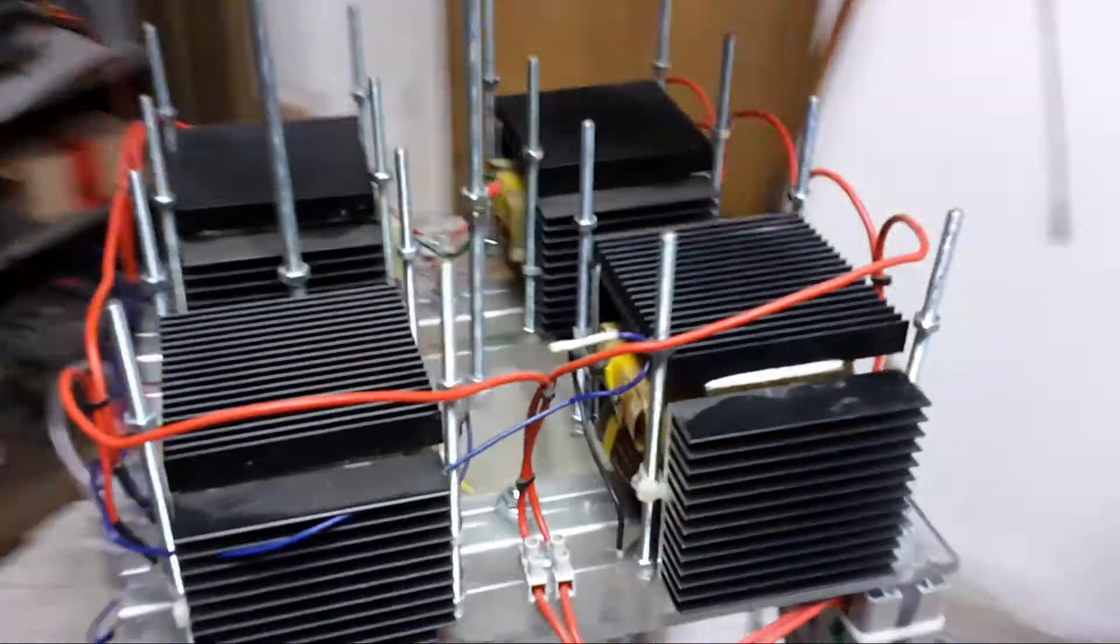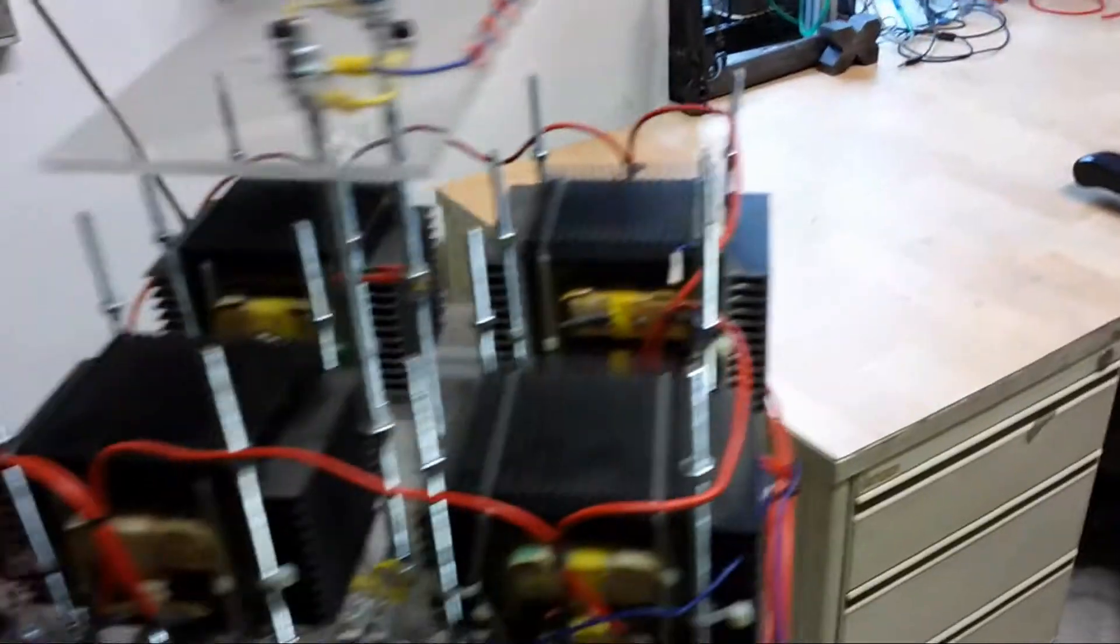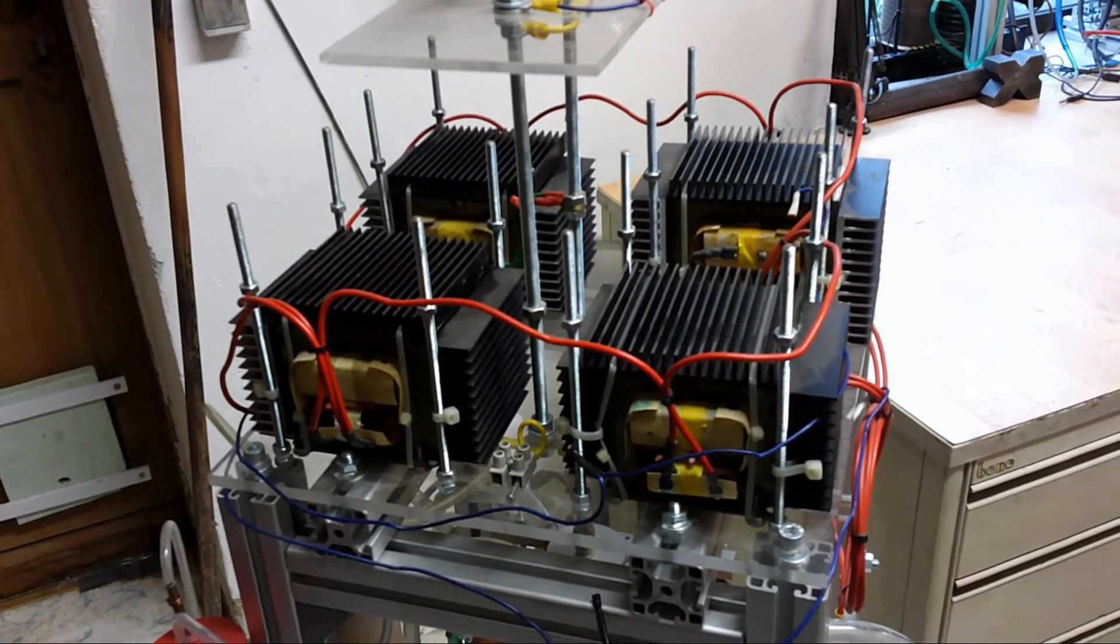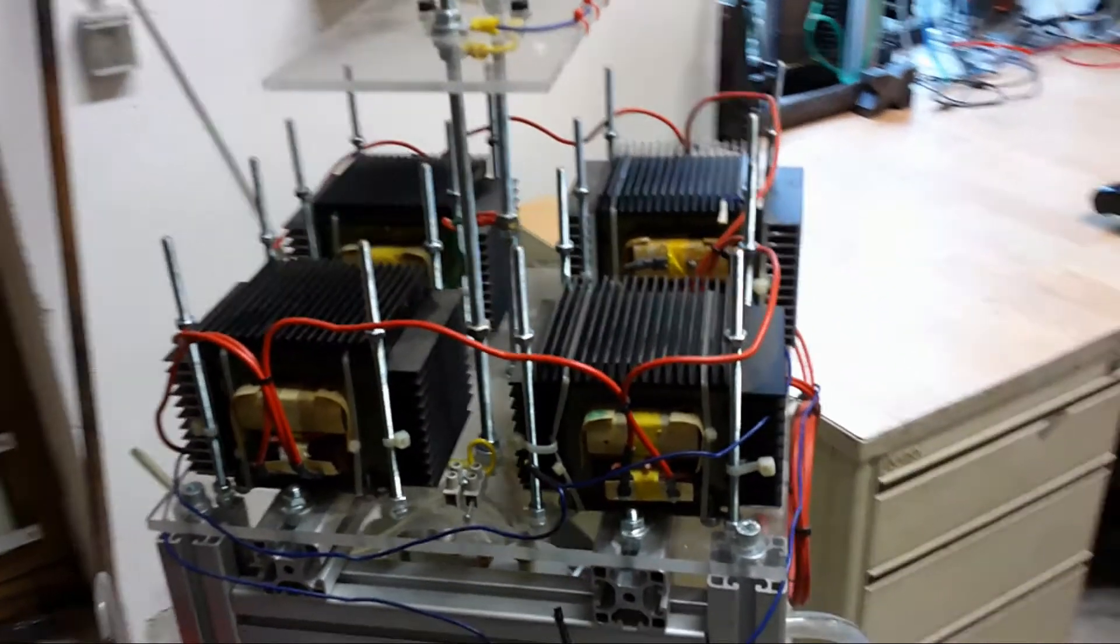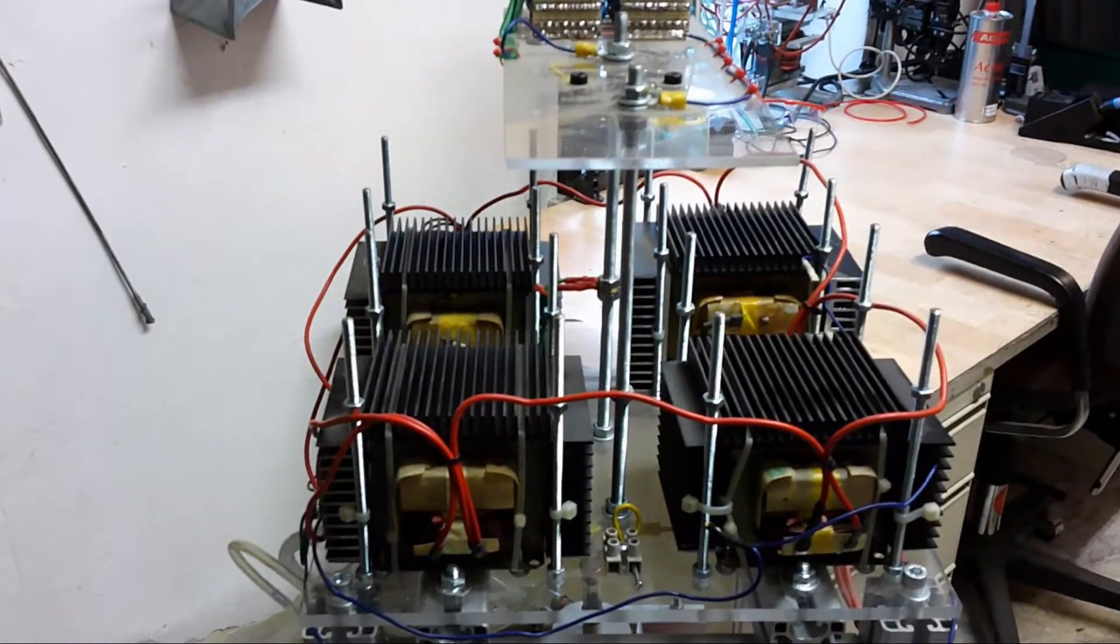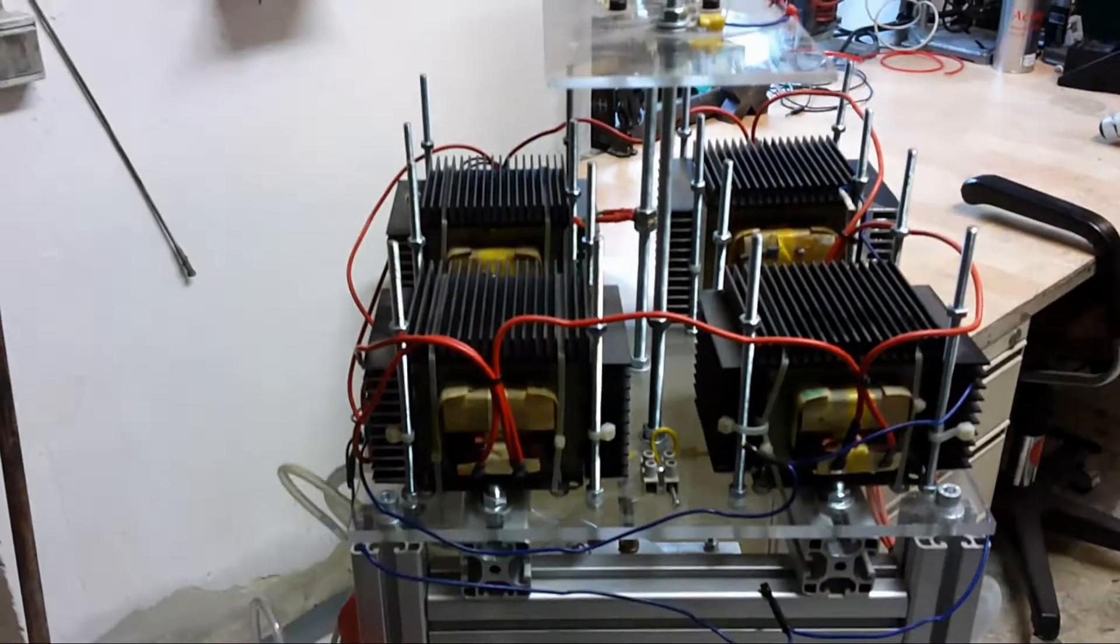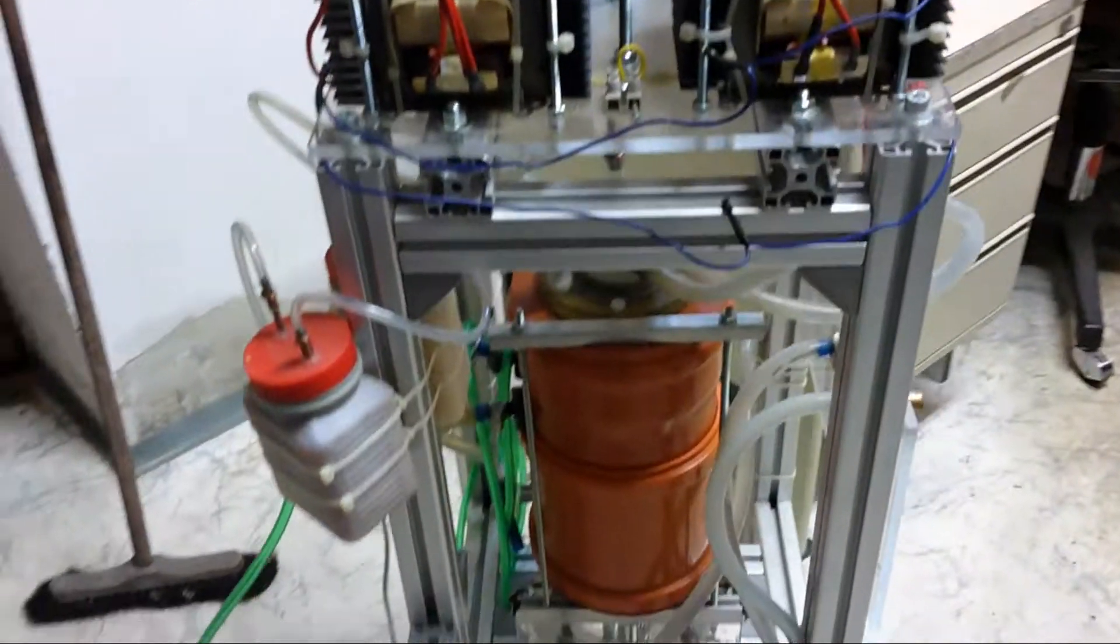This up here is the main power source. It consists of four microwave transformers. There is also a second high-frequency high-voltage power source that is not shown here yet, but I will explain that in detail.